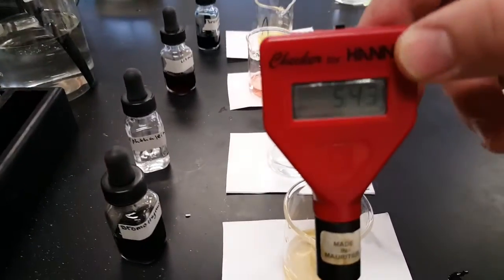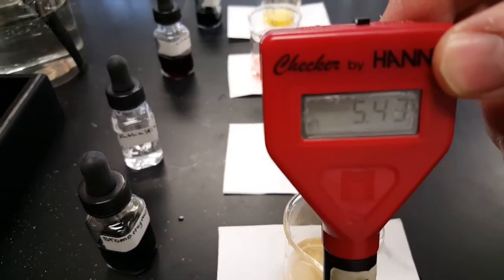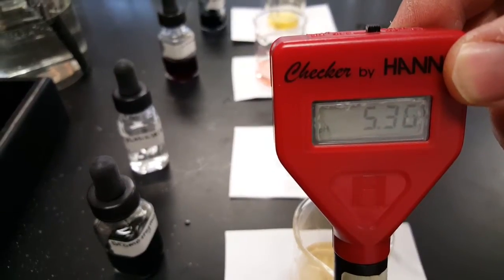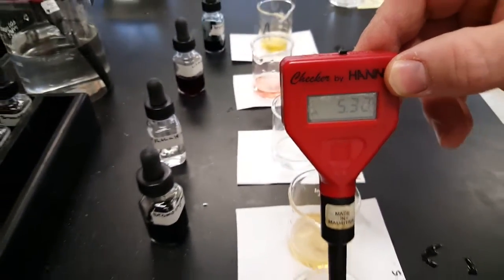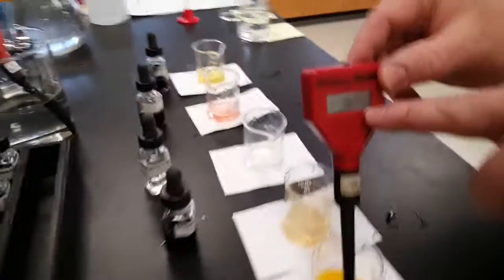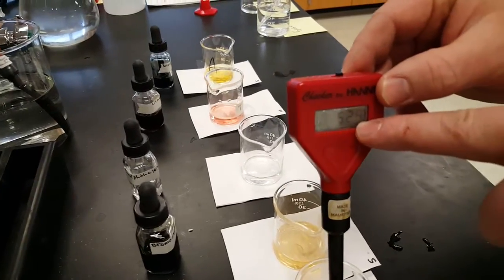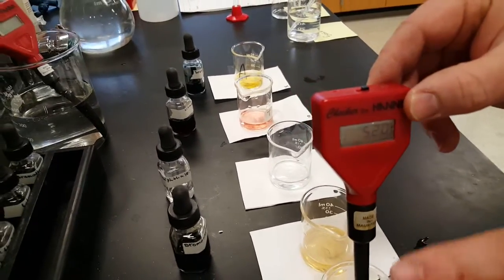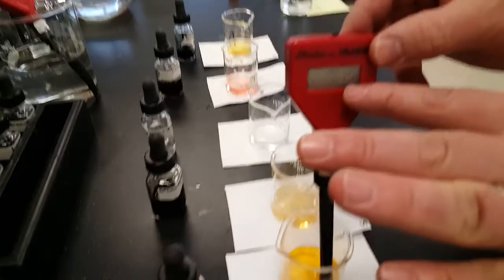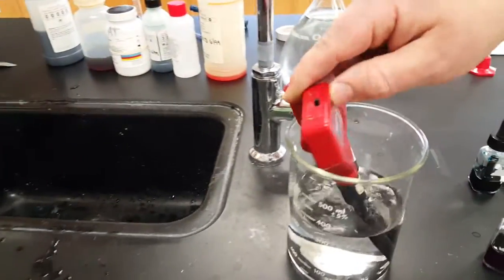So you stick it in there, and test and see. We did really good on this one. We were close to the range. So 5.3. Right, now we'll see on the reference table that this has a range of up to 4.4. So we're just proving that we are past that 4.4. And 5.3, that makes sense. It's changing constantly. Yes, it is. Go to 1 decimal place, okay? 5.1, all right? And it's not about getting it to sit still.